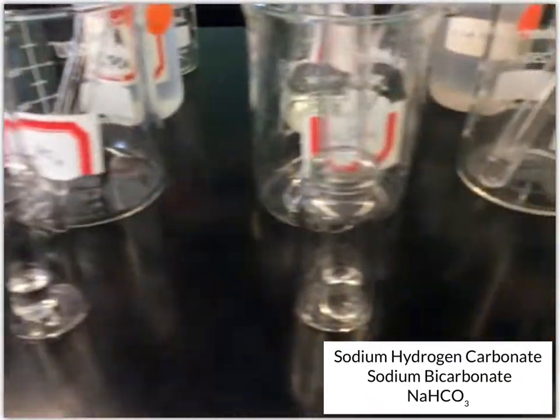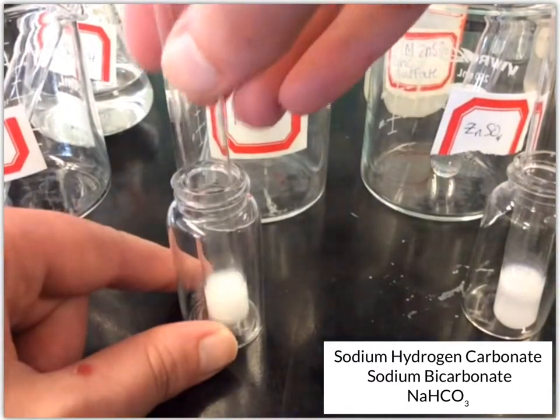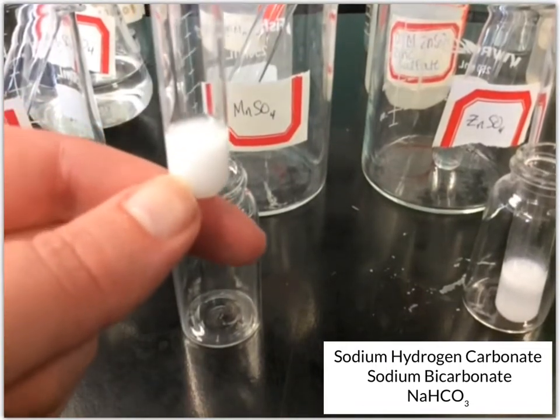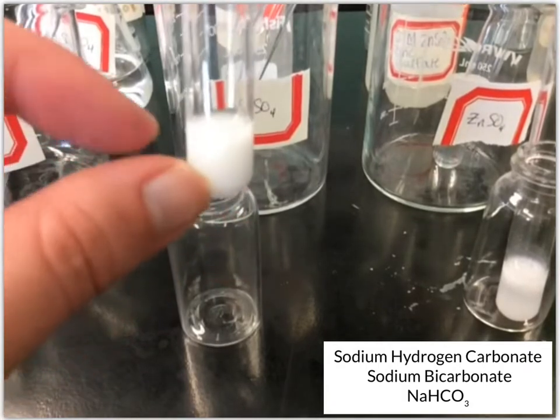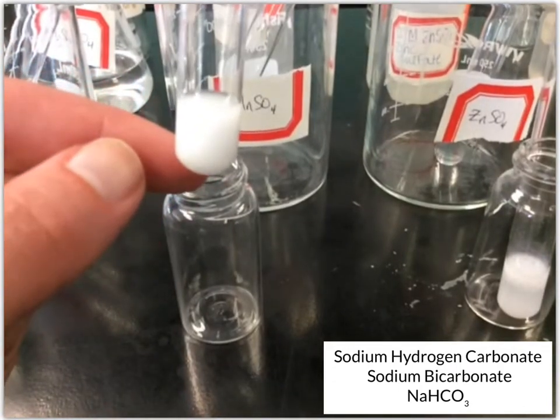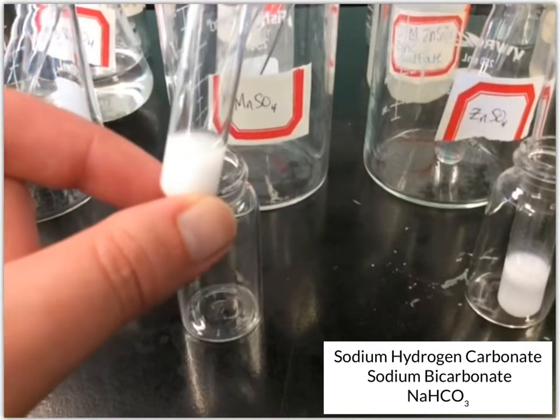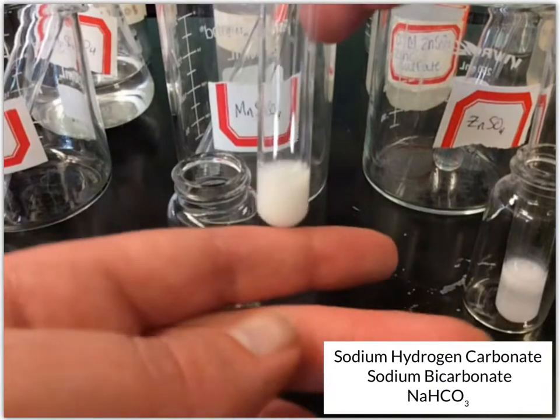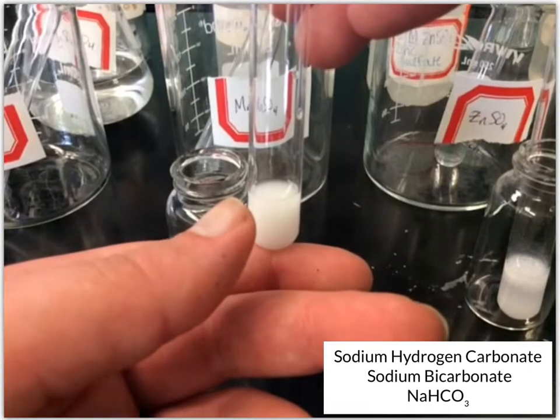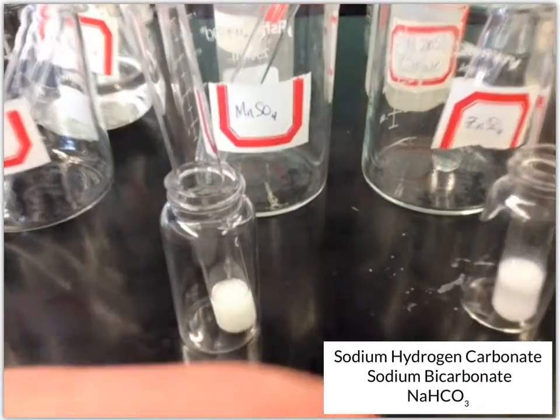And then, let's see, next change we had was manganese 2 sulfate. And so that one almost looks the same as the last one, like the very top layer starting to clear, but it's only slowly settling. And so you can see that clear layer at the top, and so it's just starting to settle. So you have some white solid in there, white precipitate, in that manganese 2 sulfate.